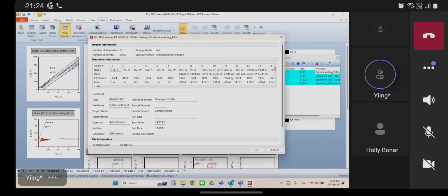What do you think about my problem, the 6 parameter? Yeah. So in this one, you're exporting all of them. And this layout is not built to accommodate that extra parameter. Remember that other data set only had 5 scatter parameters. This one has 6. So in order to make this layout work, you'd have to change all the parameters in your plots. And you don't want to have to do that with every data set, right? So what you need to do is always export just the 5 that you had in that other data set.